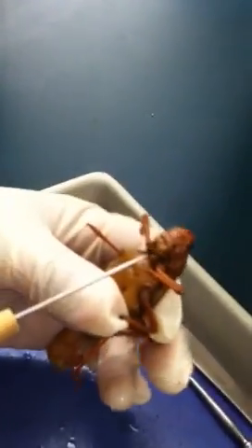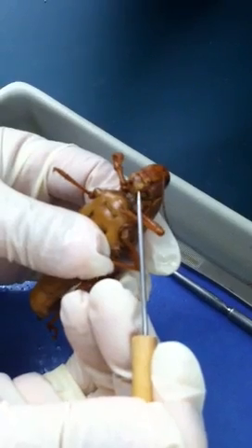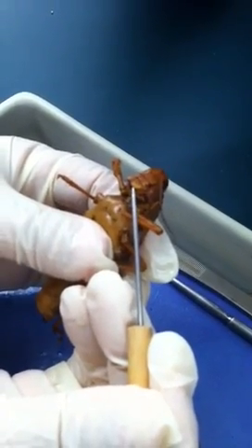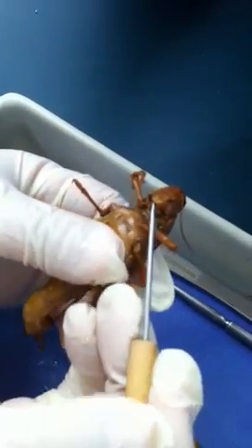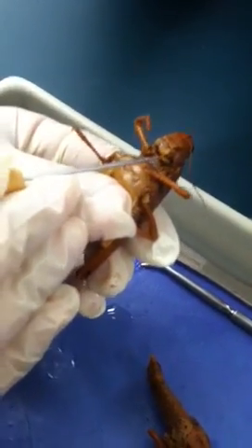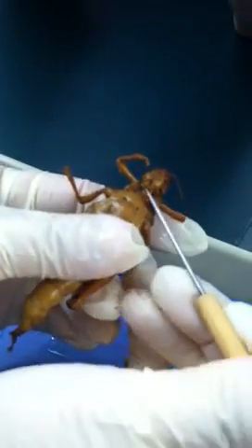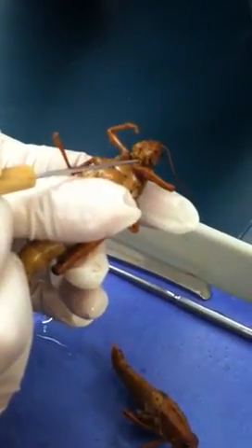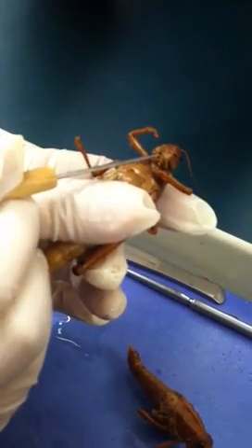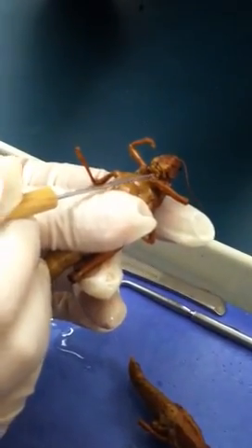After that, you will see their mouthpiece. Those are more complicated — they actually break it down into three parts. The one I'm flipping is called the labrum, L-A-B-R-U-M — that's their upper lip, the one without the palp. The middle one is what we call maxilla, and this one is the one with the maxillary palp. And then the bottom one is what we call labium, L-A-B-I-U-M. The labium also has a palp called the labial palp. So one more time: labrum, maxilla with maxillary palp, labium, and labial palp.